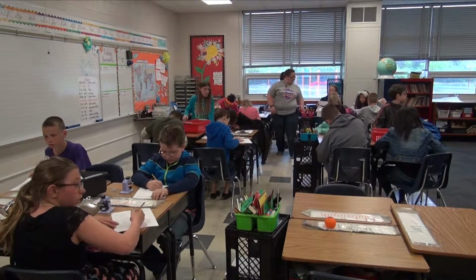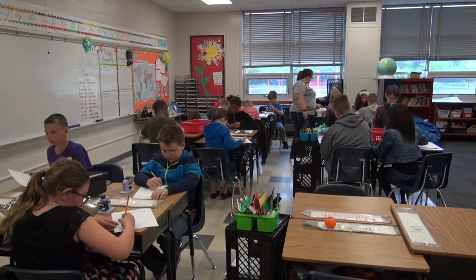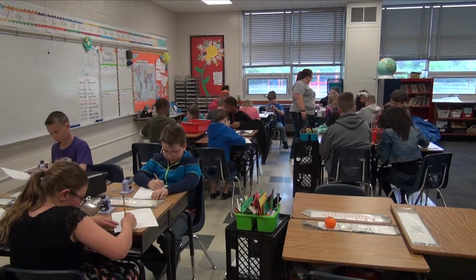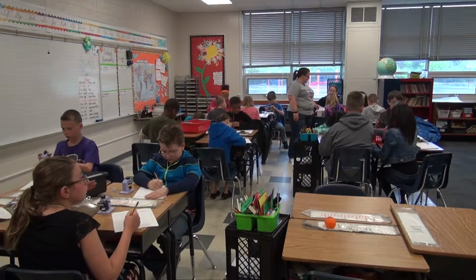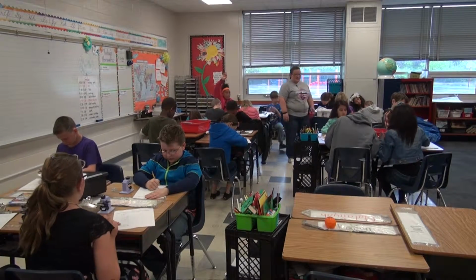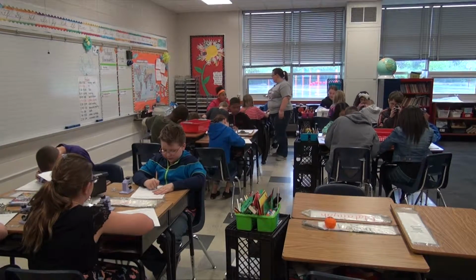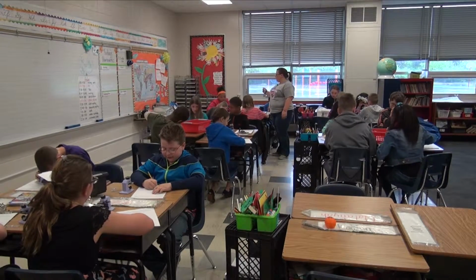I think I grabbed the exact one that I have right now. What slide number is that? You're supposed to look at it. I think I just grabbed because this one, the picture looks exactly like it. It does. Good. Do we supposed to like write it down? Write down what clues you got from that.